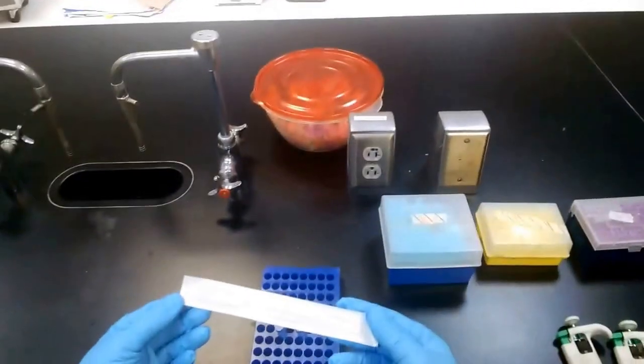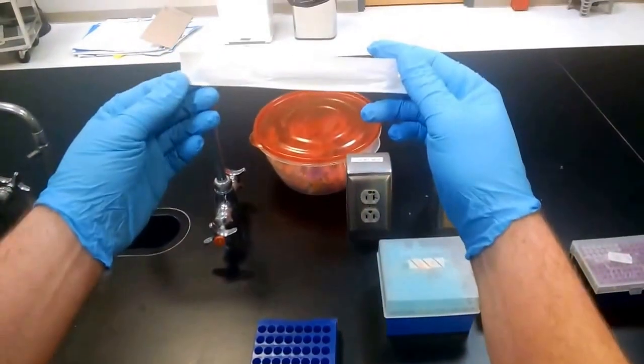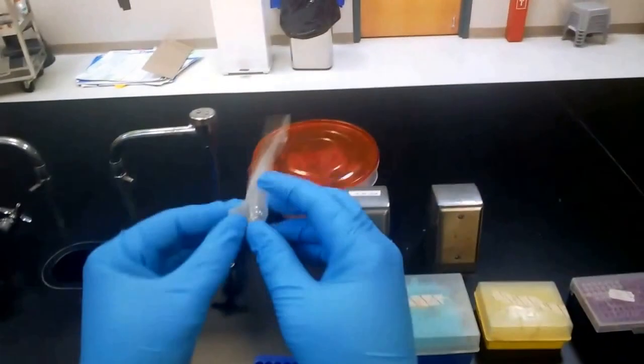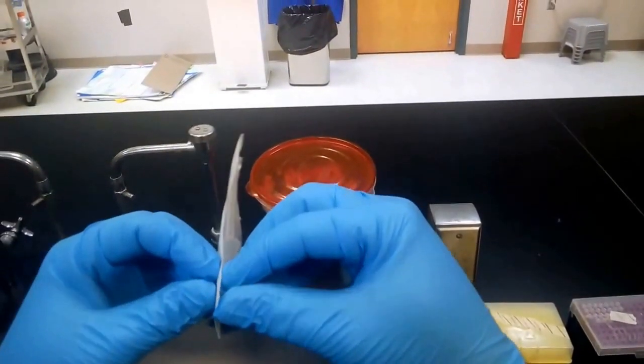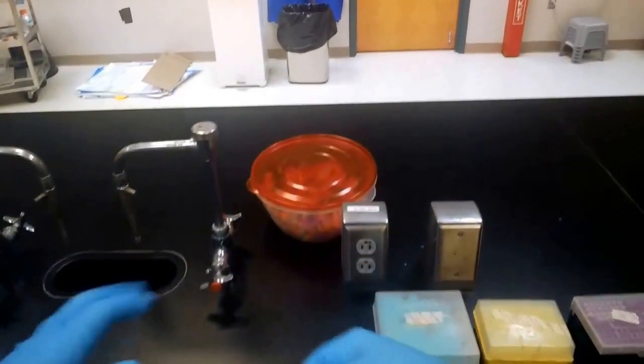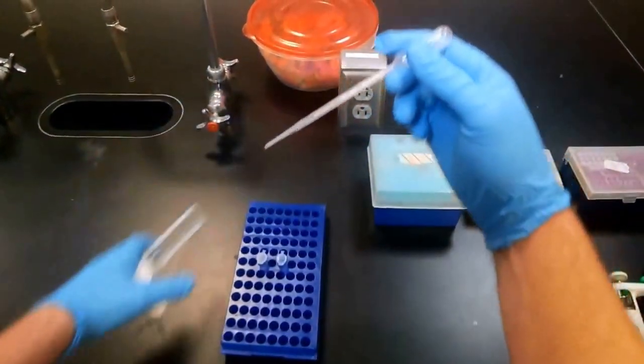We'll start by examining a Pasteur pipette, which is not much more than an eyedropper. These are sterile and are often used for moving around media.